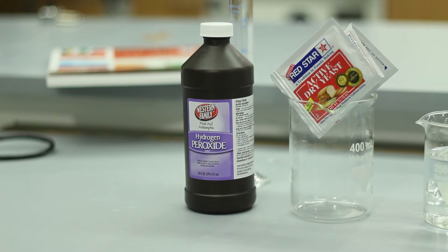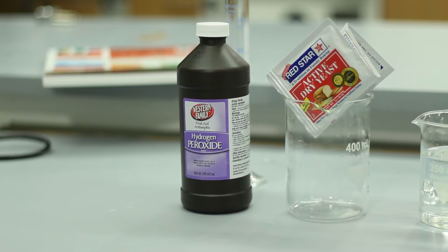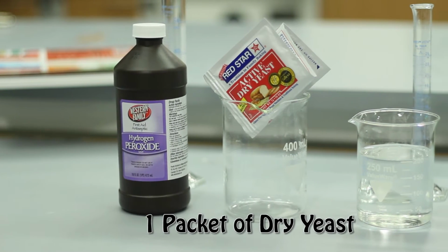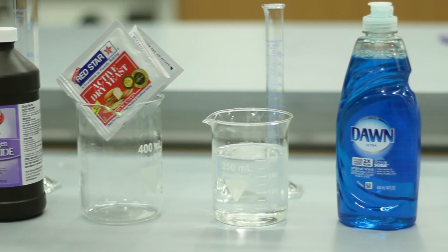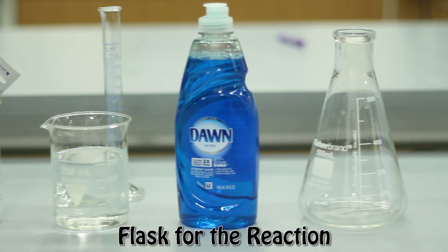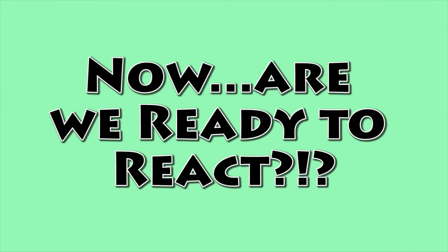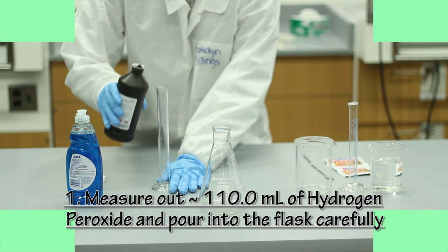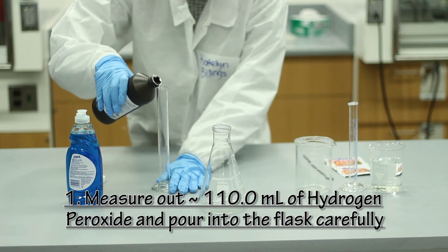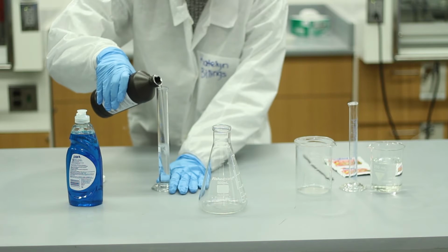For this reaction, we are going to need 110 milliliters of hydrogen peroxide, 1 packet of dry yeast, 15 milliliters of warm water, liquid dish soap, a flask, and of course, safety goggles and gloves. Measure out approximately 110 milliliters of hydrogen peroxide and pour it into the flask carefully.